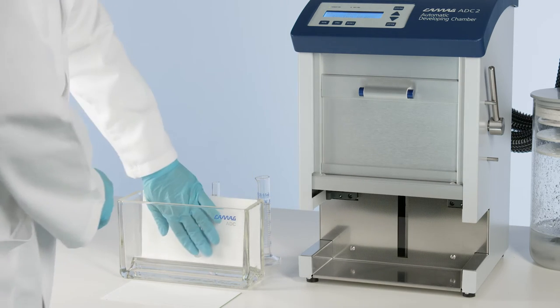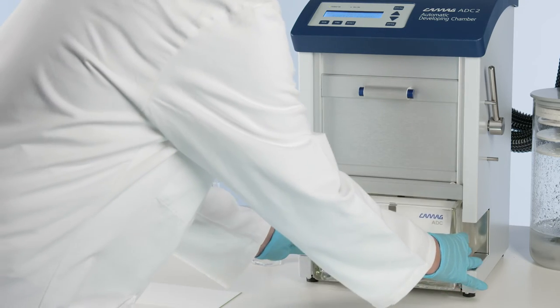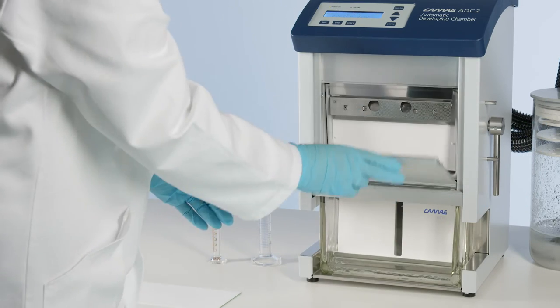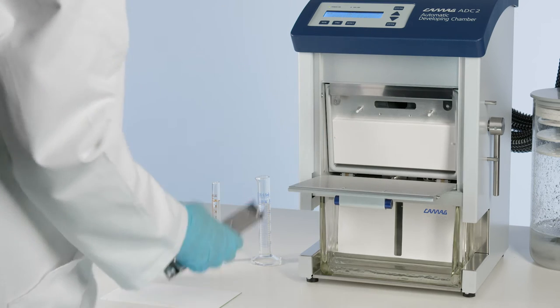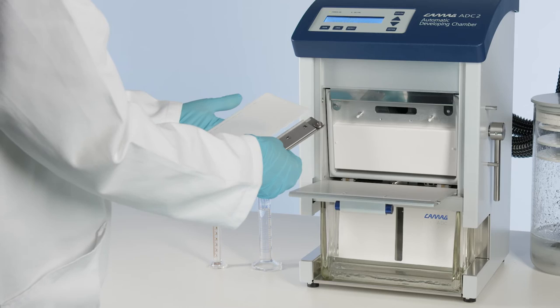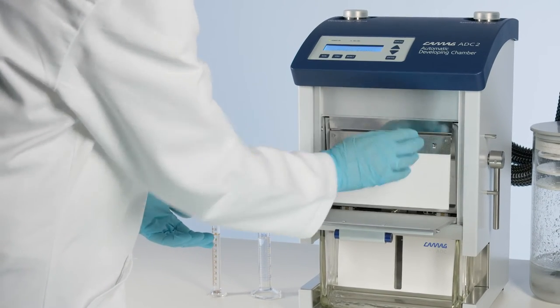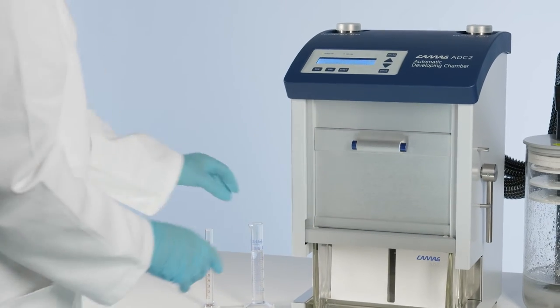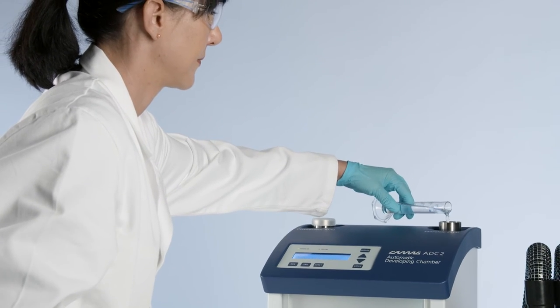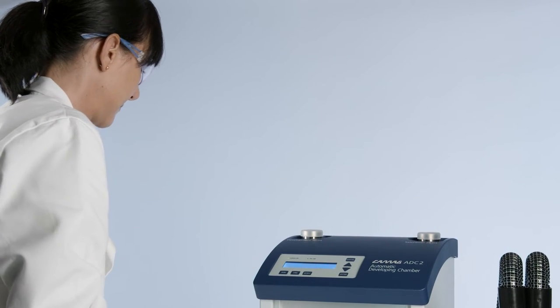The ADC2 will automatically develop the plate, leaving the analyst free to do other work. The ADC2 provides development under controlled conditions. Open the front door, load the applied plate in the plate holder and insert the plate into the automatic developing chamber. Pour in 10 ml of the developing solvent for plate development and 25 ml of developing solvent for chamber saturation into the solvent ports.